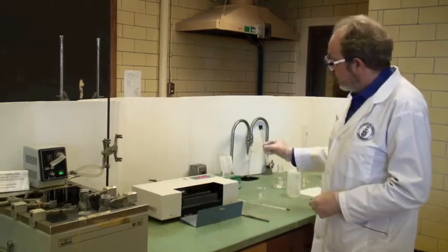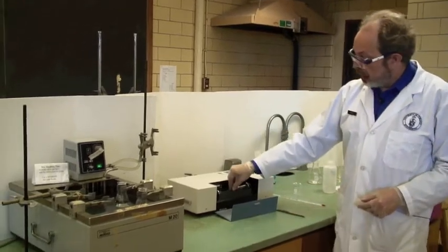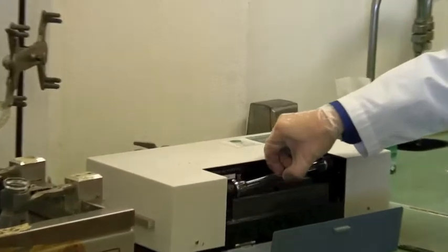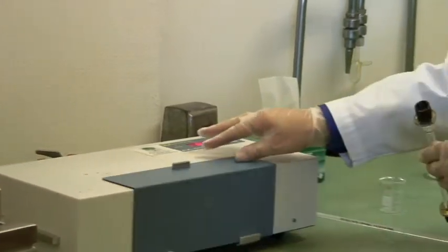And the sample container, the cell, actually sits in the gray holder like that. We will have to fill this shortly. We'll leave that open.